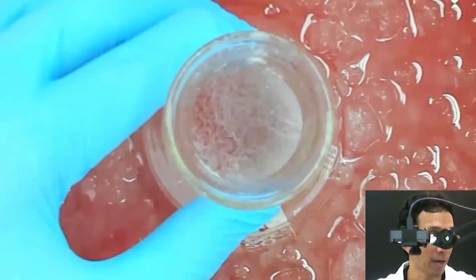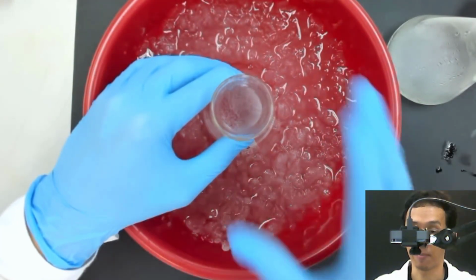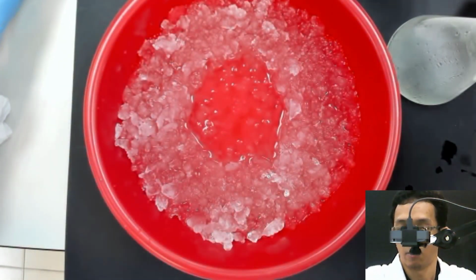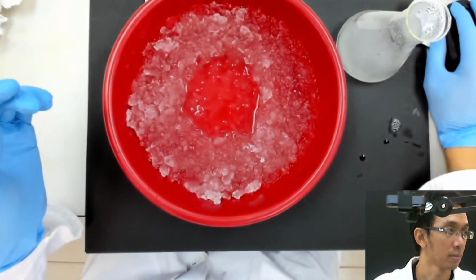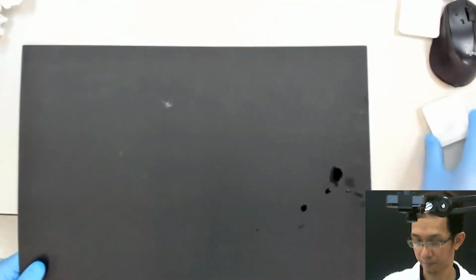So the last part now is that we want to filter this out. The last part for this experiment, we want to filter this out. Just another like 5 minutes and then we're done with this. So we take out there, bring there.